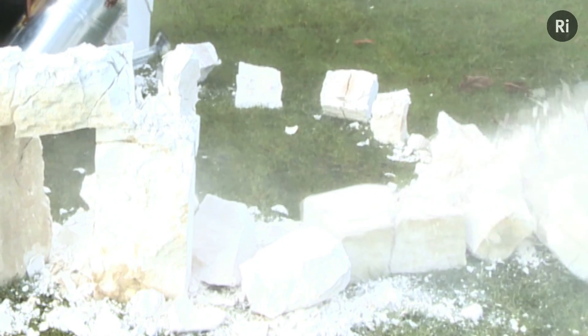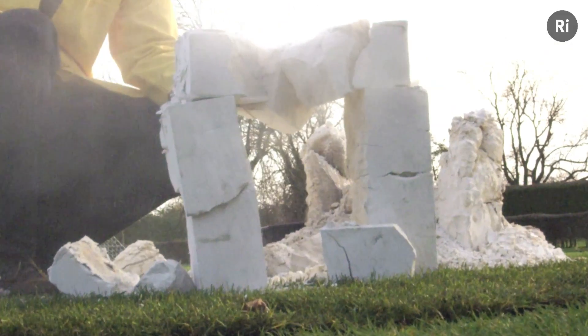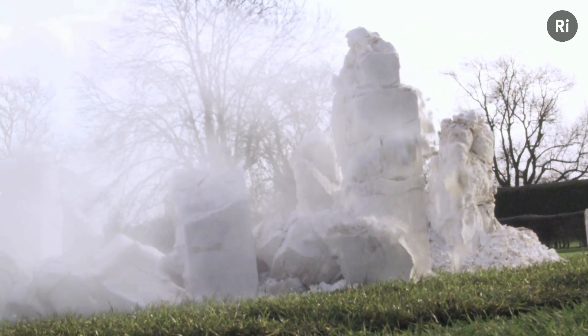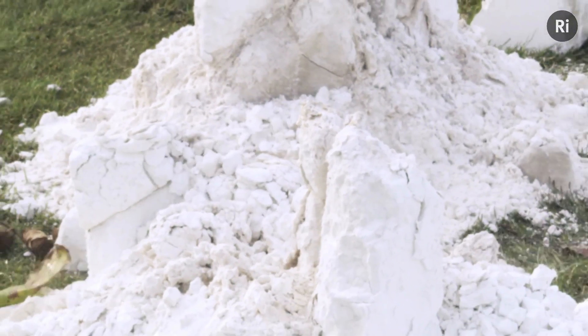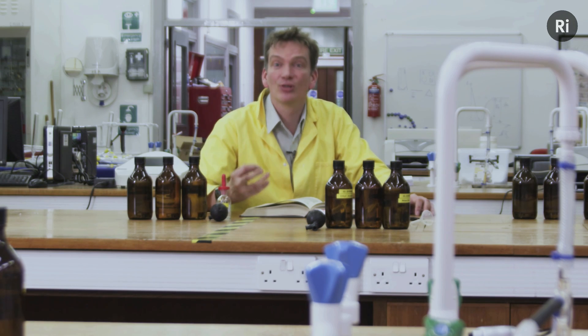Quicklime literally means living lime, and we can see this as the water instantly vaporises, turning into steam in this very violent reaction. It's combining with the quicklime — we can see it crumbling away, blistering, bits of it flying off and popping in all directions, generating a lot of heat which we can see as the steam here. During this process called slaking, the calcium oxide reacts with the water to form calcium hydroxide. This is a key component of cement and has been used since Roman times and is still used today.